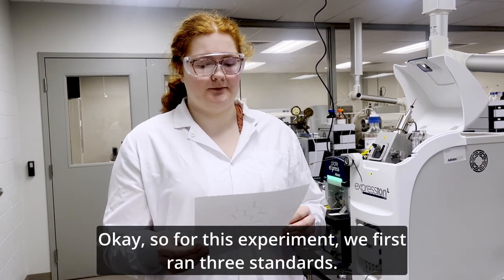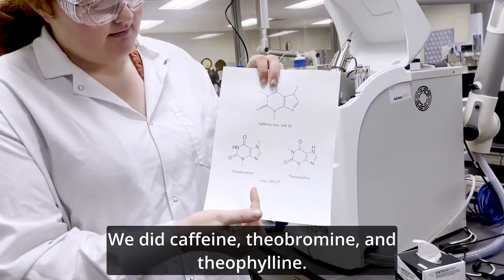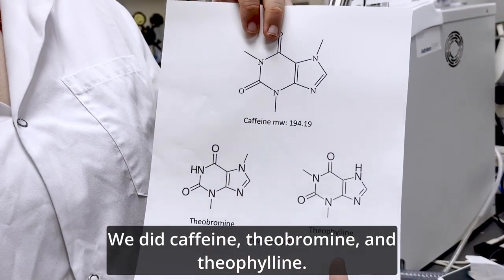Okay. So for this experiment, we first ran three standards. We did caffeine, theobromine, and theophylline.